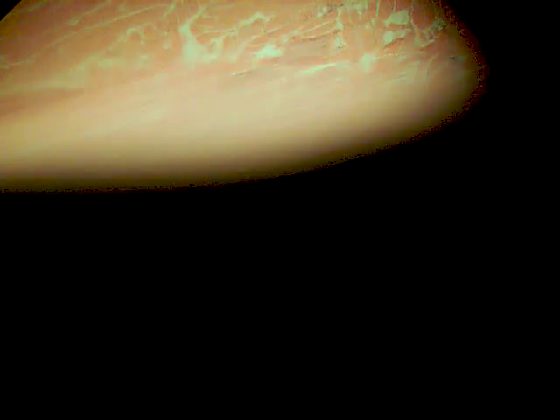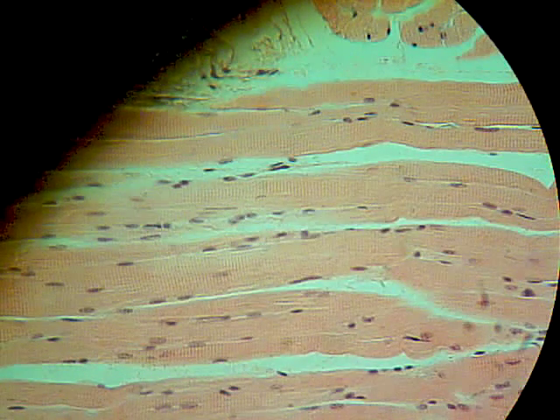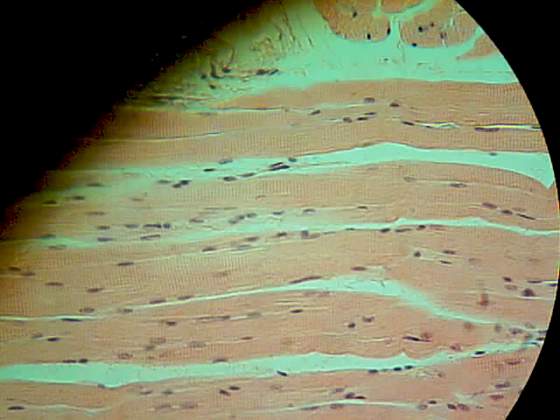Going back down, scanning again to locate the final section. I'm going to go to the very bottom of this — this is the muscular layer. And this is probably the most dramatic of the three because you can actually see the striations. This is the skeletal muscle; it's a striated muscle.